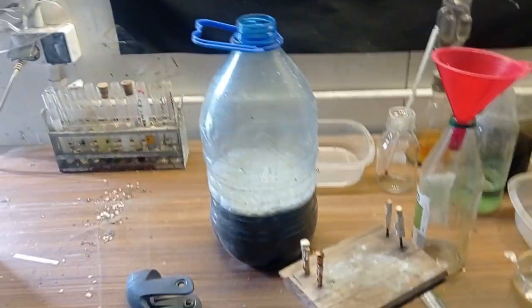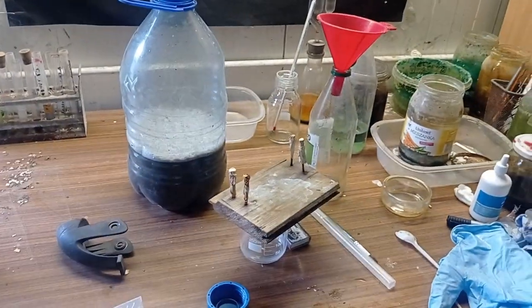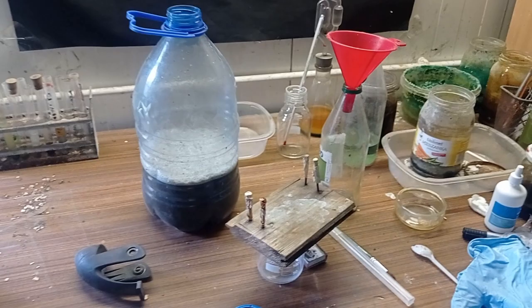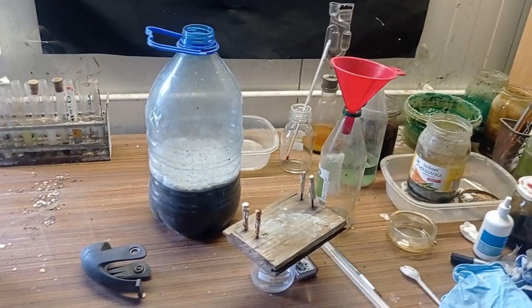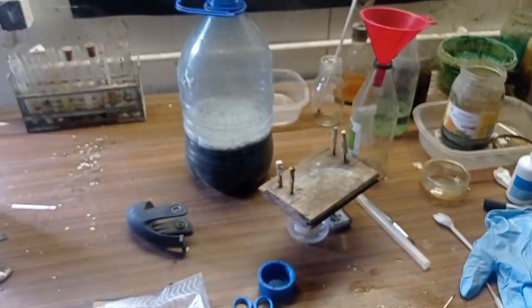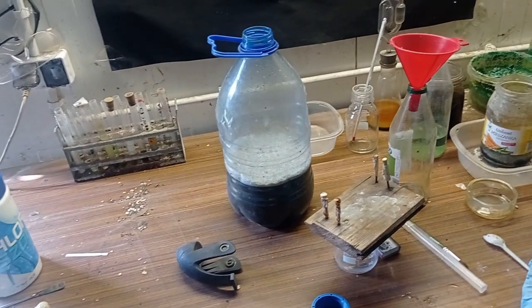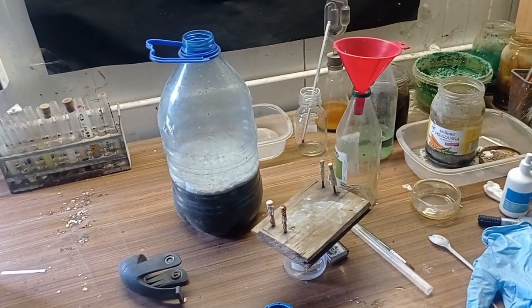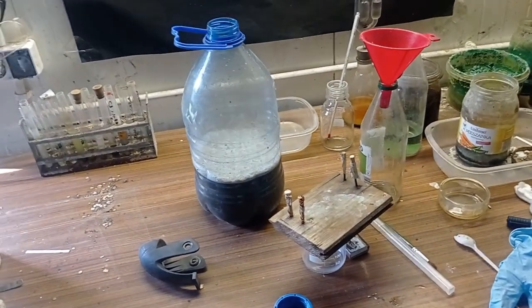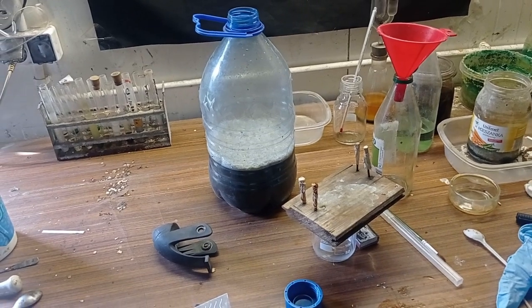I found a 5-liter plastic bottle and poured the mixture with scraped out crystals. That was really a pain to move that cluster of crystals, eggshells, and ashes. Then I added an additional one and a half liters of water and left it for another night.